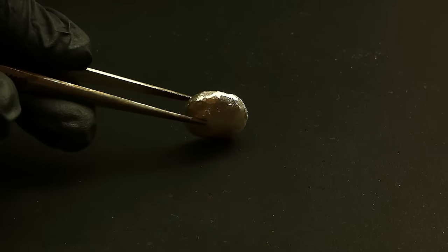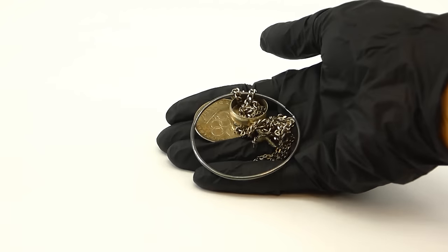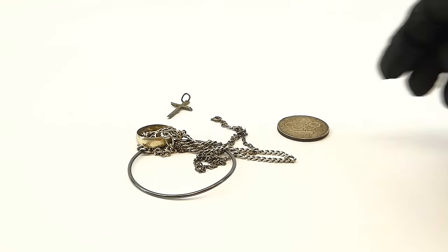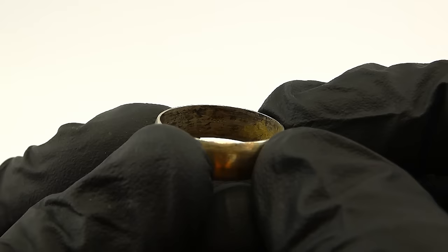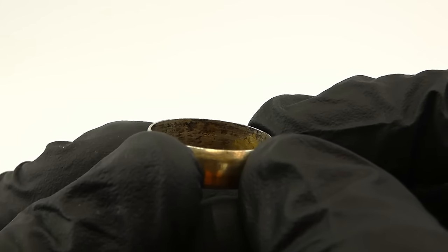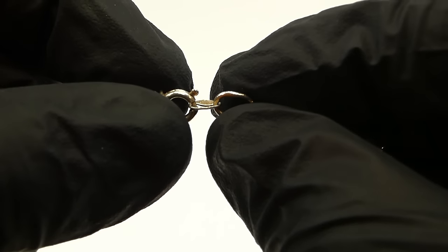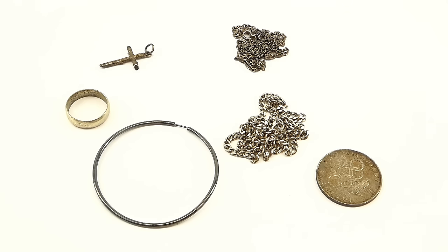To begin I of course have to get some silver, and since it isn't something that you can just get from the hardware store, I had to get creative. After searching around the house, I found some old and unused silver jewelry, along with a silver coin, all of which already consist of some rather pure silver, as indicated by the characteristic black tarnish. Some of the jewelry is also marked with the number 925, which means 92.5% pure silver. However, the mirror making process is really sensitive to impurities, so first I would have to clean the silver up, or in other words refine it.